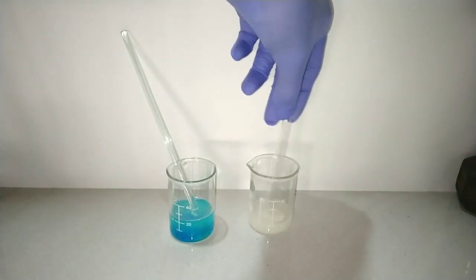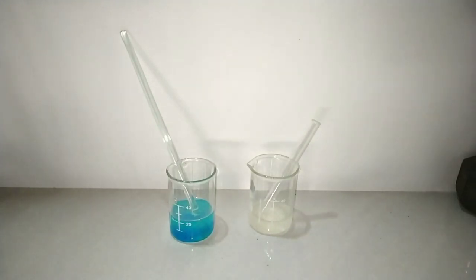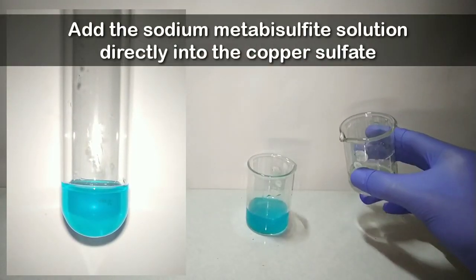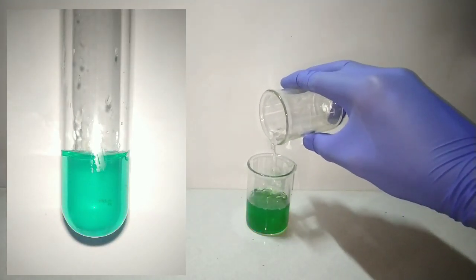We are actually using a very small scale for this reaction. If the smell of sulfur dioxide seems disagreeable, do it in a fume hood or outside.